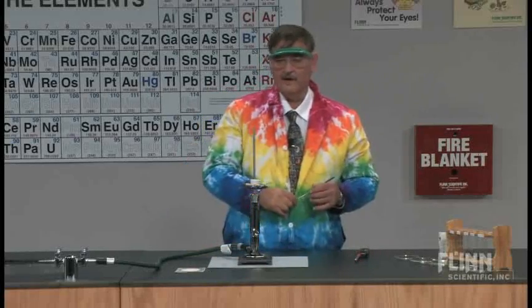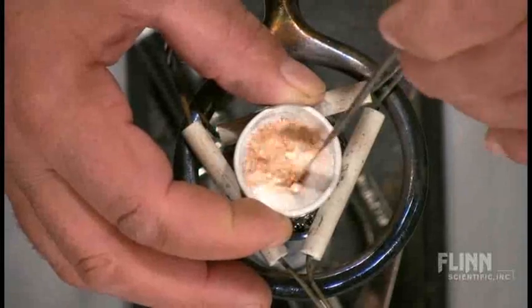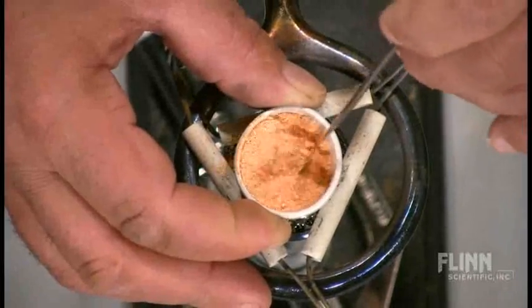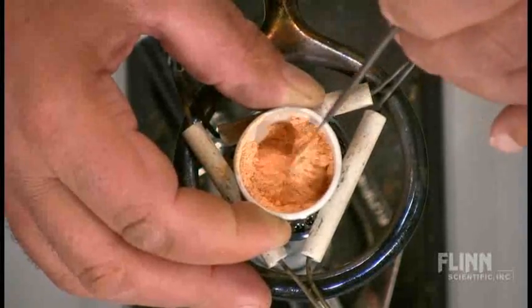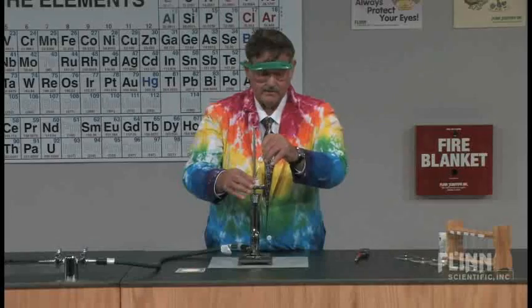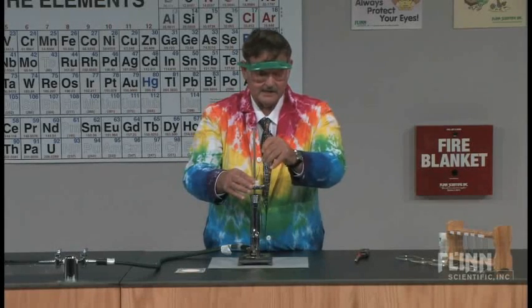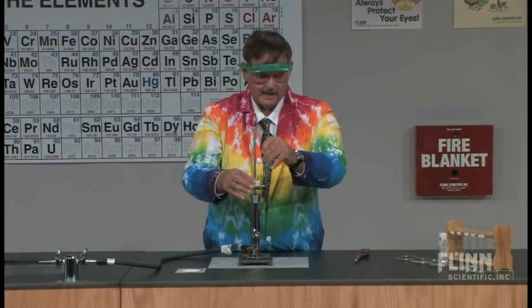I have 6.5 grams of lead(II) oxide in here, which is kind of an orange. I have 3.5 grams of boric acid, and half a gram of zinc oxide. We're going to heat this up while I show you some of my previous work, so that we can talk about what the end result looks like. Today I'll add some manganese contaminant to this, and we'll see if the manganese has potential for being a colorant for some glass. So we're really making leaded glass here.